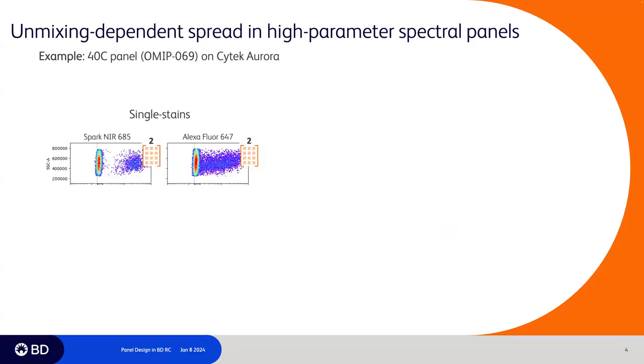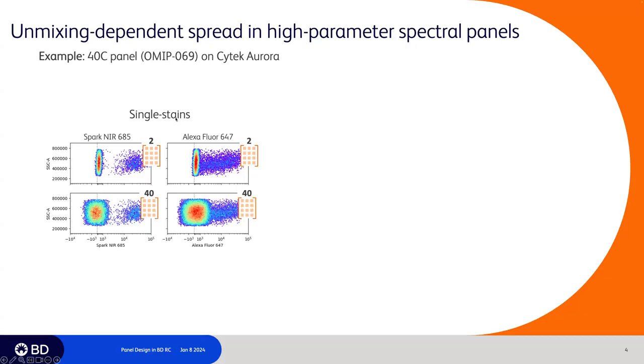So in this example, if we look at single stain samples, either Spark NIR 685 or Alexa Fluor 647, that have been unmixed with themselves and autofluorescence only, so they have each been applied an unmixing matrix of 2, you can see that these have good resolution. The negative population is nice and tight, and there's nice separation between the negative and the positive. However, if you take those exact same samples and apply a different matrix to them, in this case a 40 color matrix, you can see that the single stains are affected by this unmixing dependent spread, and this leads to widening of the negative population and a loss of resolution. So in this case, you can no longer accurately gate on those dim events.